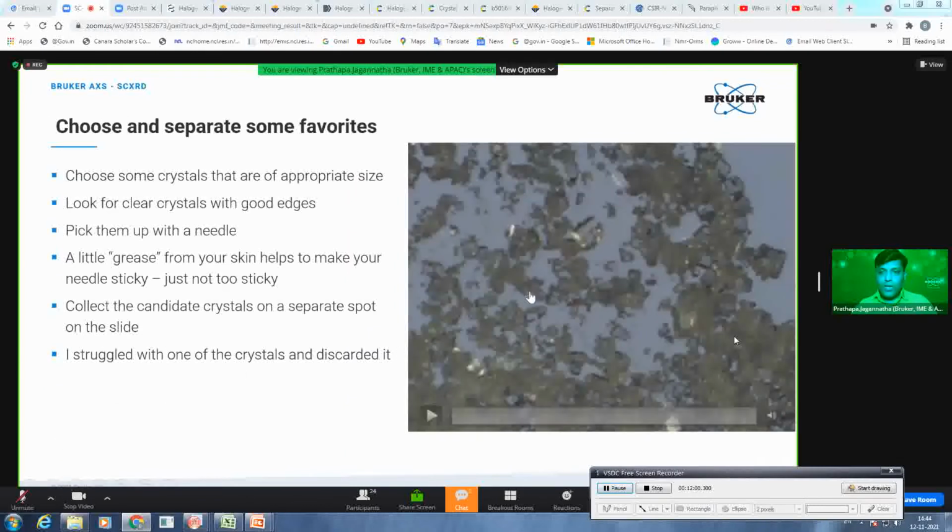These are some videos my colleague from Karlsruhe, Dr. Tobias Stutzer, has put in to show you how we mount the crystal, because we can't come to your lab now. Now we can show only through video. So they have collected some videos and put them in for you to show how we take care of the crystal. What we do is we work under a microscope.